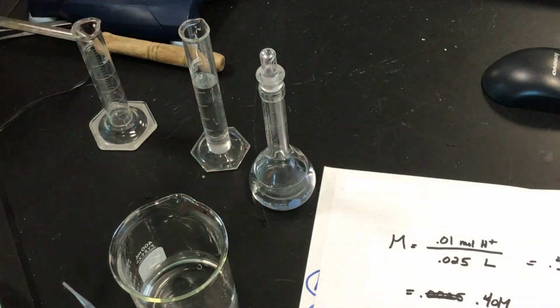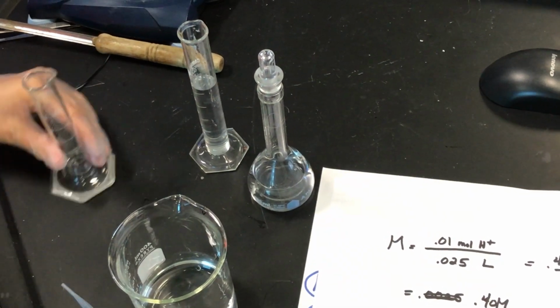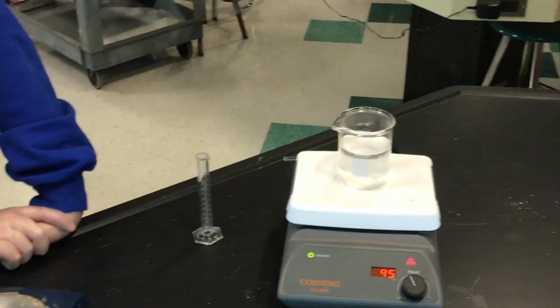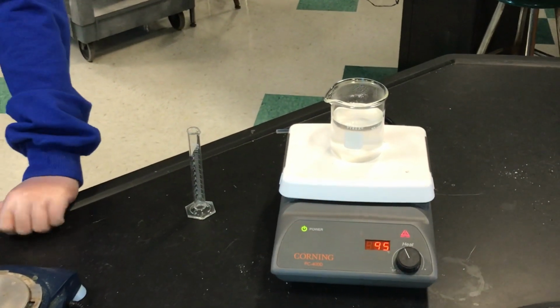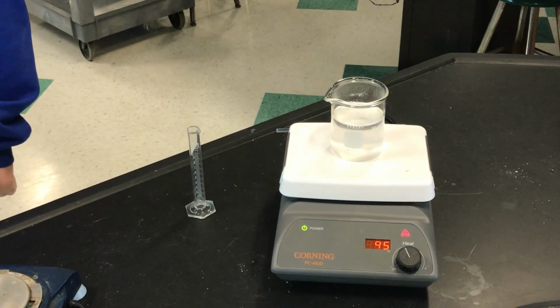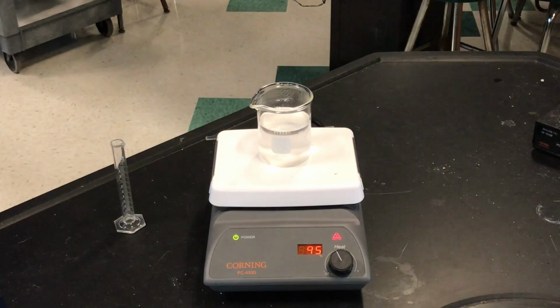So you're going to add 10 milliliters, okay? Now, while you're doing that, we can get to the other part of the lab. So you're making another, so we have 50 milliliters. That's my bad, we should have decided that. The reason I decided to do that is that I didn't think about the next part. We're going to titrate with the hydrochloric acid. 25 would be the target, we may need more or less. In any case, she's going to make 50 by doing that again carefully.